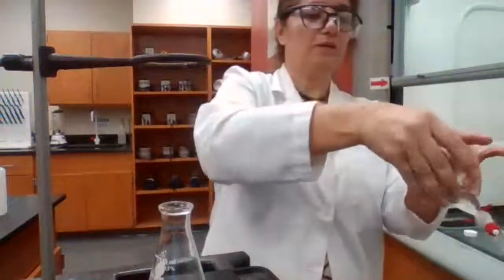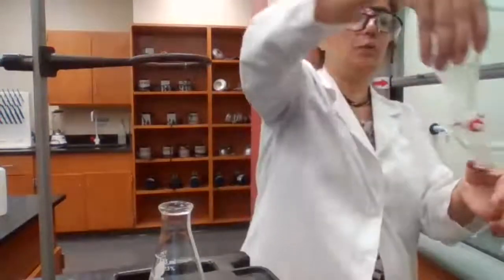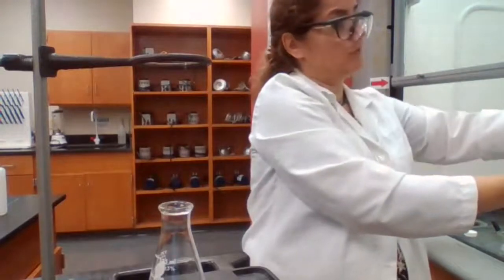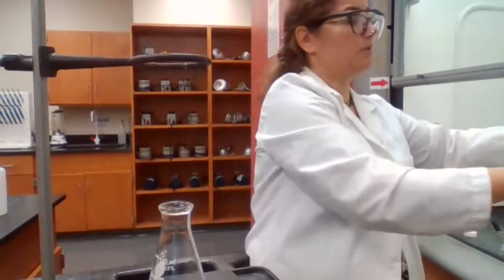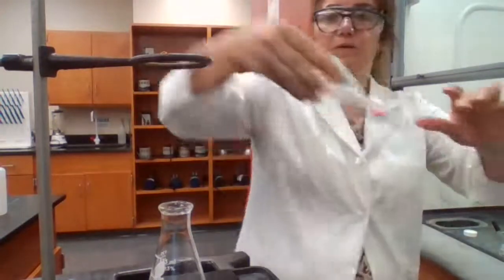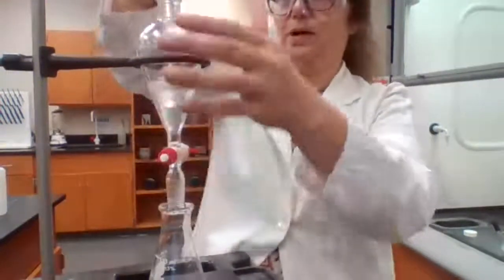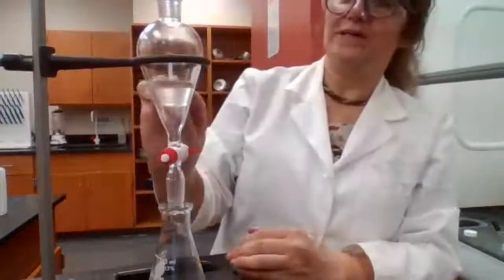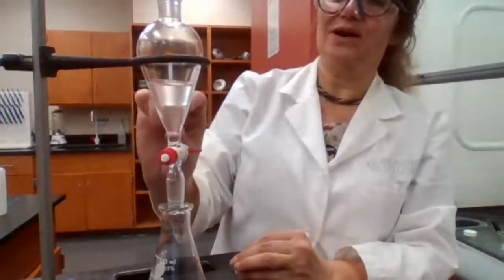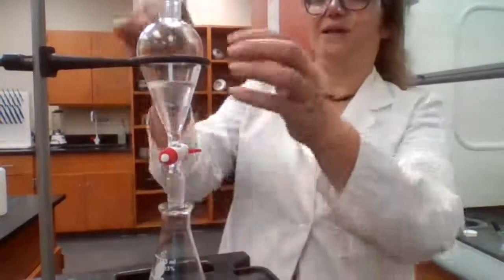So we wash the organic layer with water to recover any leftover soluble products. It works in two ways. One, it makes sure that the organic layer doesn't have any water soluble product. Second, it recovers every water soluble product and places it in the flask that we had with the acid.